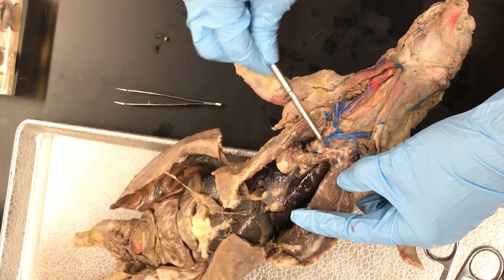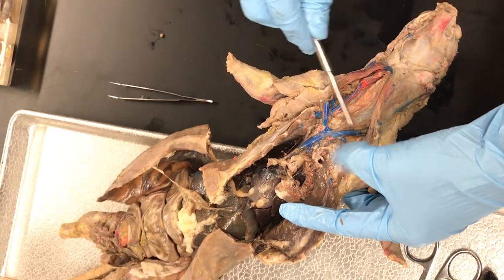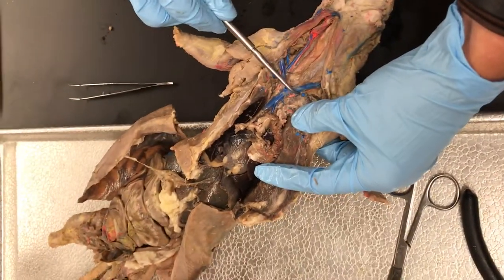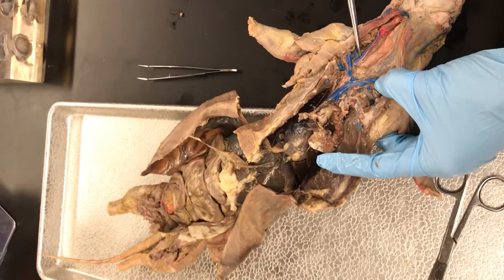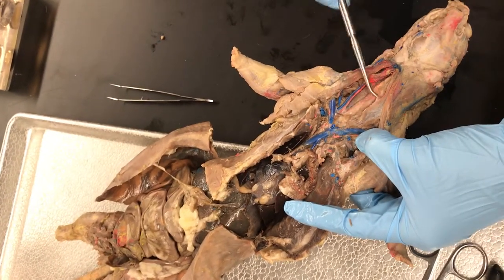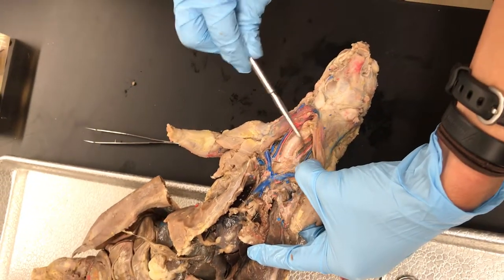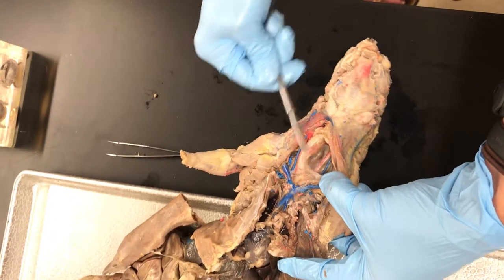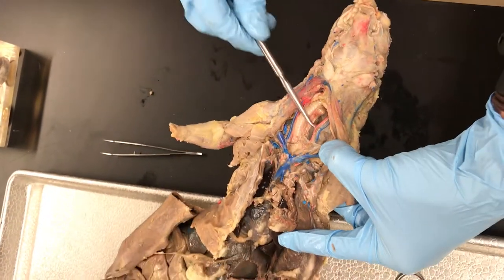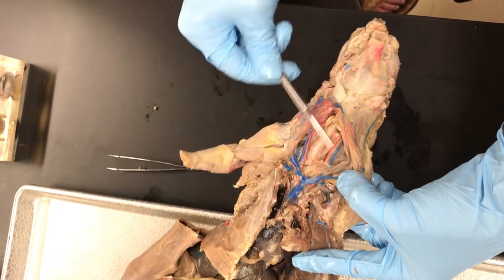You can see that top part of the superior - or the cranial - vena cava right here. That's where we see our branches: these are our two external jugular veins, and there's part of a subclavian vein right there. They're going to be the first places where we branch off. Here's an internal jugular vein that's pretty easy to see, and that red one right next to it is a common carotid artery. Let's see if we can uncover the trachea - there's the trachea. Behind the trachea is the esophagus - remember we saw that in lecture, how it sits right behind the trachea. There's your other common carotid artery and internal jugular vein. And if you look closely, there's a little white strand - that's your vagus nerve in that trio on either side of the trachea.